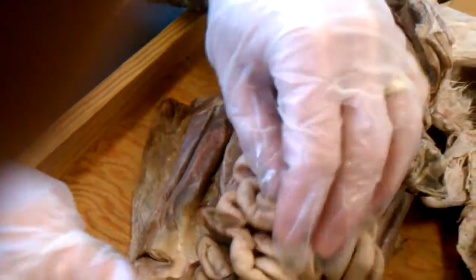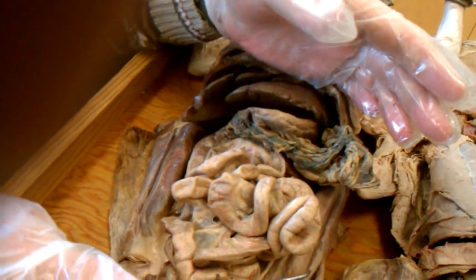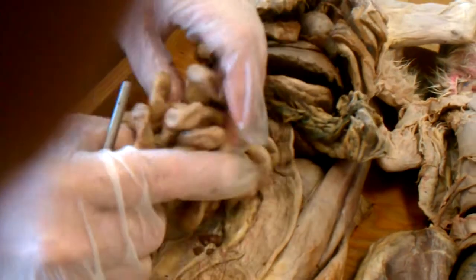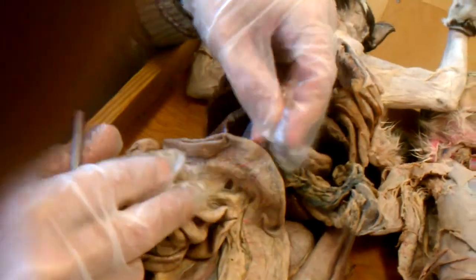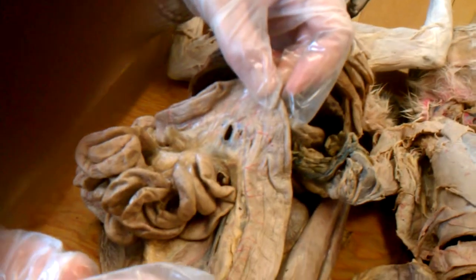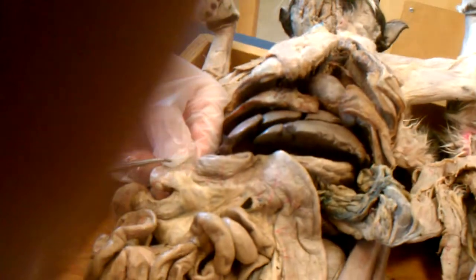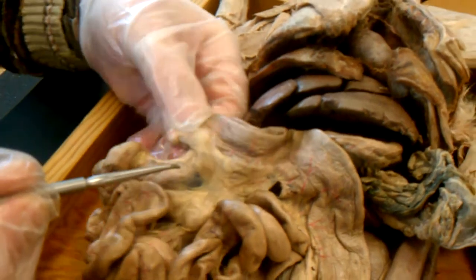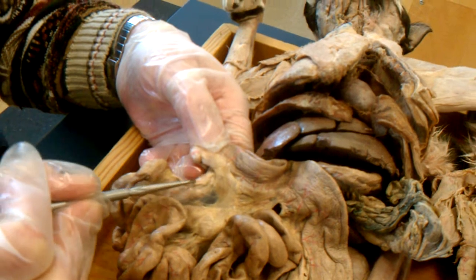Out here in the center, you can't tell. You can only say that these are small intestines. To pick out the last part of the small intestine, the ileum, you work backward from the large intestine, or colon. So if we pull the intestines off to the right, here is the colon, which is sort of question mark shaped. At its very beginning, there is a blind sac called the cecum. And emptying in at that point, this is the ileum of the small intestine.